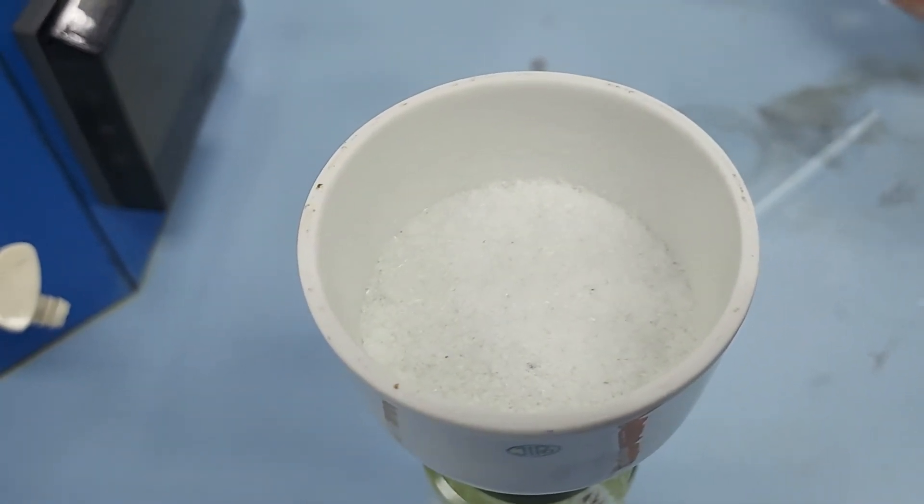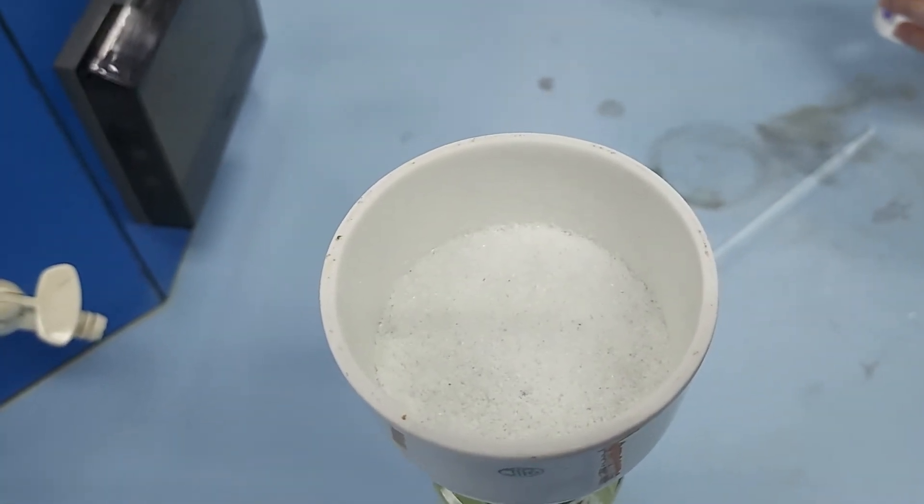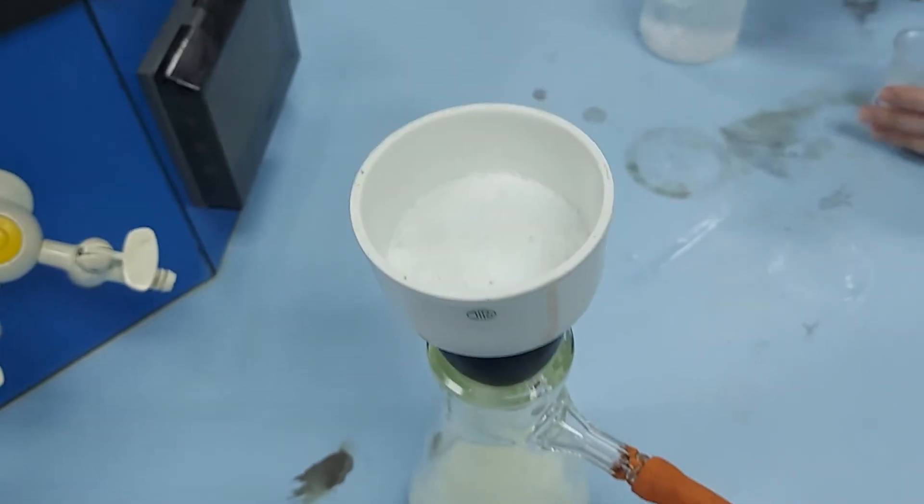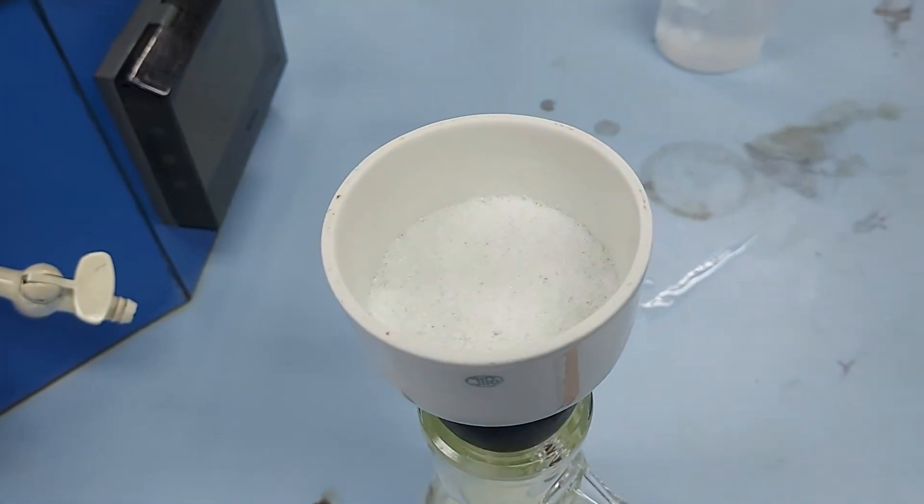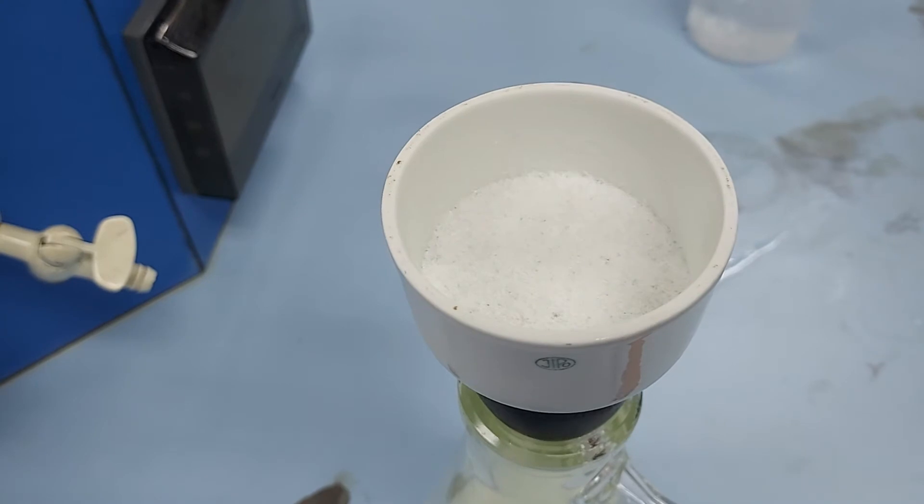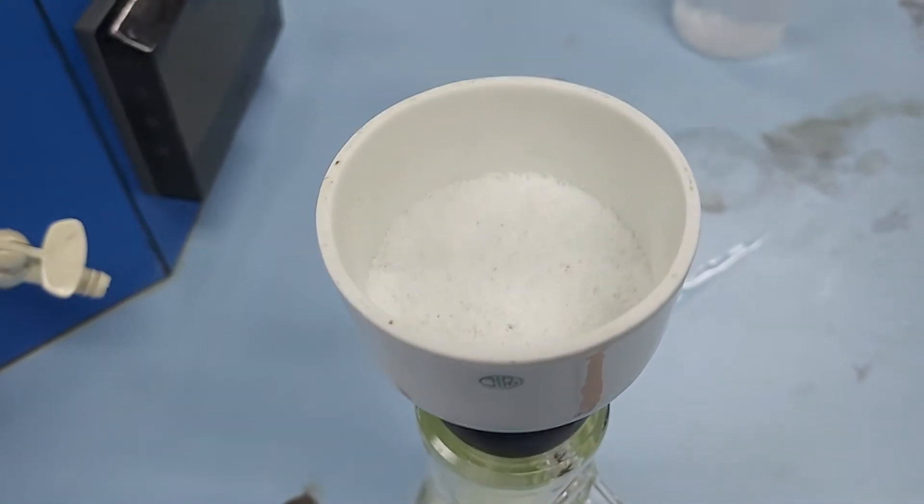These are then going to be air dried and then they're going to be placed in an oven to dry overnight. Then we can perform a melting point.